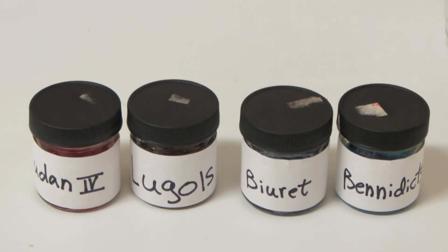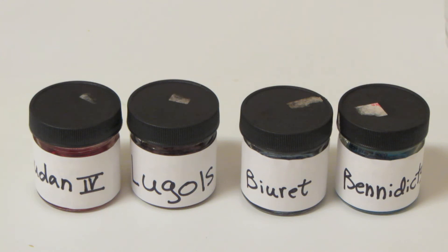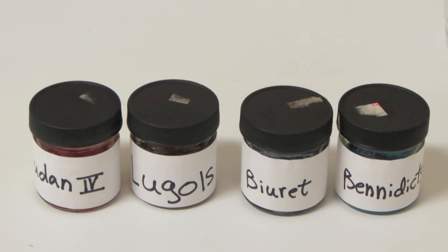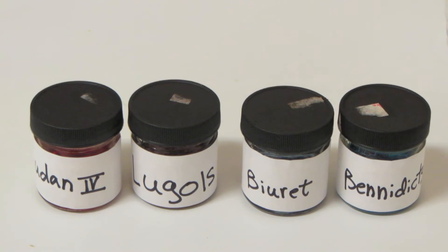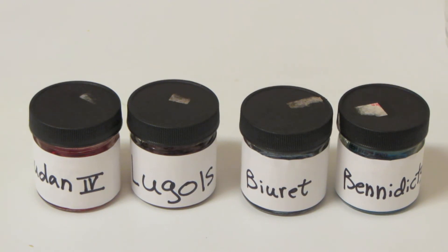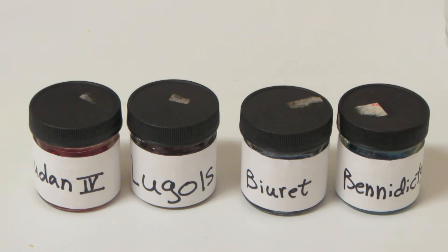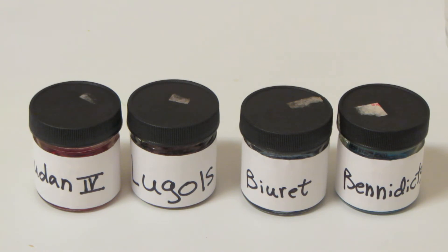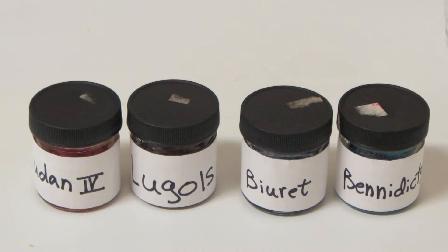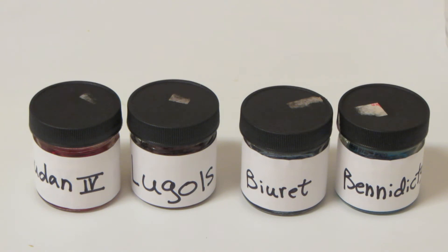Welcome to our introduction to digestive chemistry. The first thing we're going to talk about is the four different solutions we use to identify our different foodstuffs. The foodstuffs we need to identify are going to be fats, otherwise known as lipids, proteins, and carbohydrates.